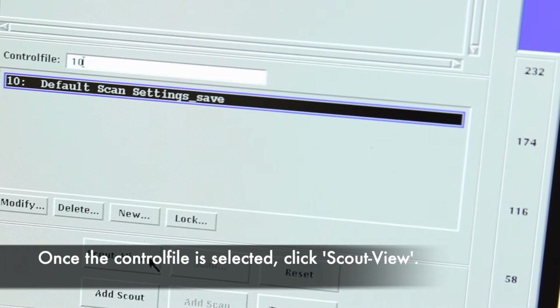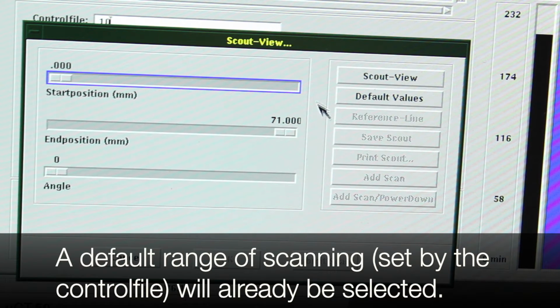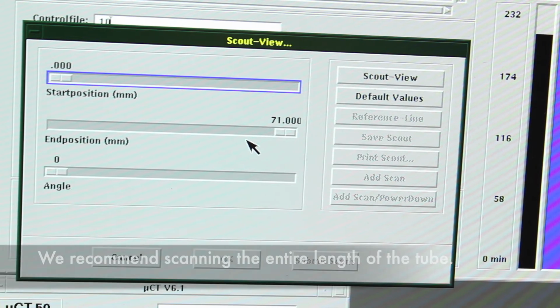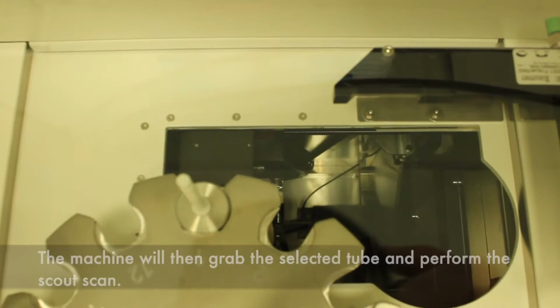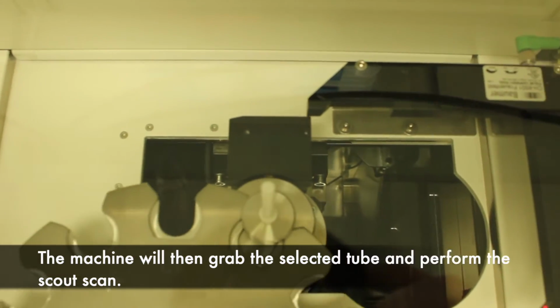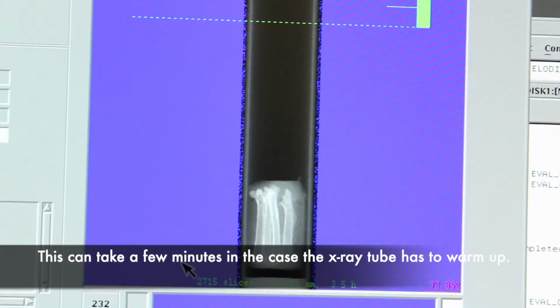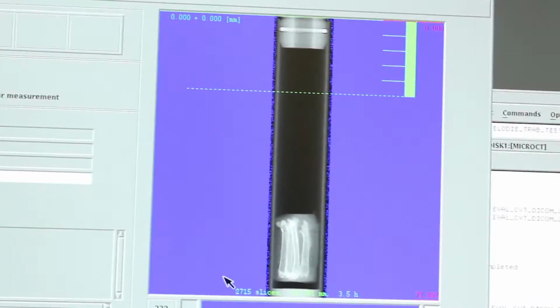Once the control file is selected, click Scout View. A default range of scanning from the control file will be selected. We recommend scanning the entire length of the tube. Once the range is set, click Scout View on the right. The machine will then grab the selected tube and perform the scout scan. This can take a few minutes in the case the X-ray tube has to warm up. Warm-up time is at most 20 minutes.